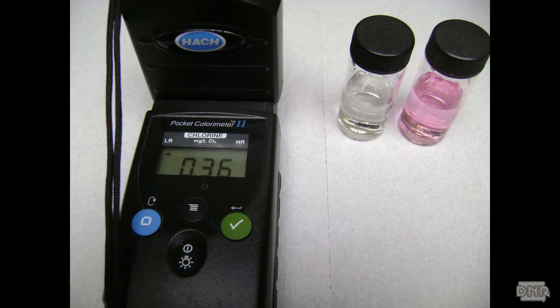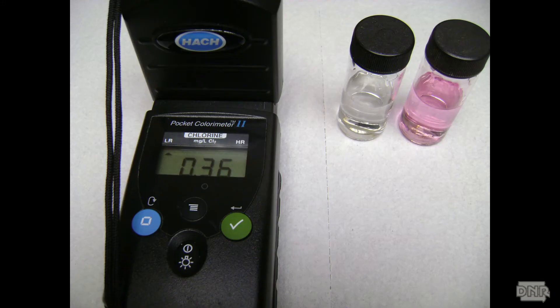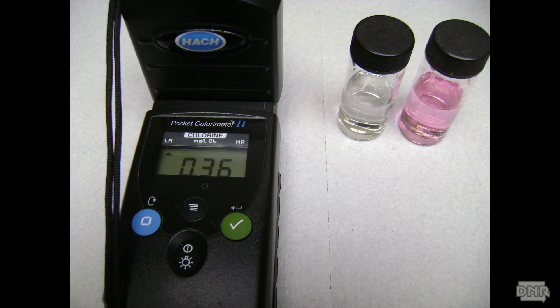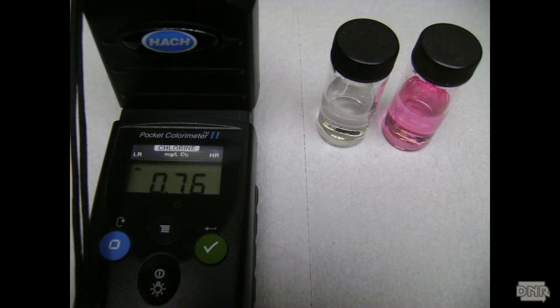If this value increases, you are using chloramines and do not have true free chlorine. If the value is stable or does not change more than 0.1 mg per liter, you are using free chlorine and the minimum free chlorine residual is 0.3 mg per liter. The free chlorine residuals must be greater than 0.3 mg per liter throughout the distribution system except in very low use areas. If your free chlorine measurement was not stable, you are chloraminating and the free chlorine reading is false. In this situation, you must maintain at least 1.5 mg per liter total chlorine residual throughout the distribution system except in very low use areas.